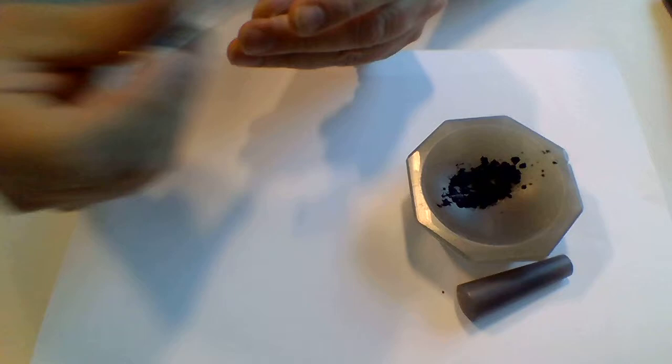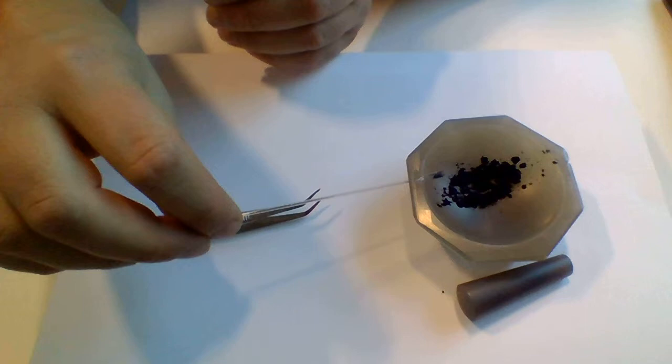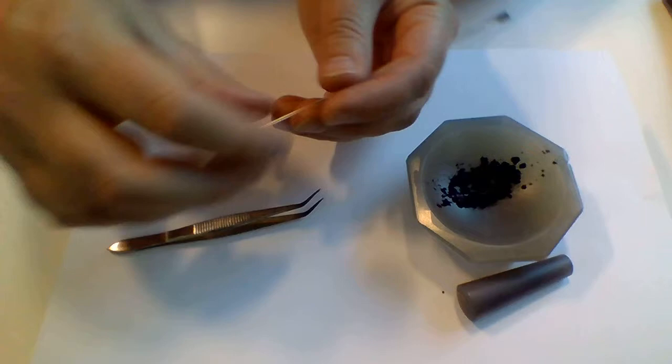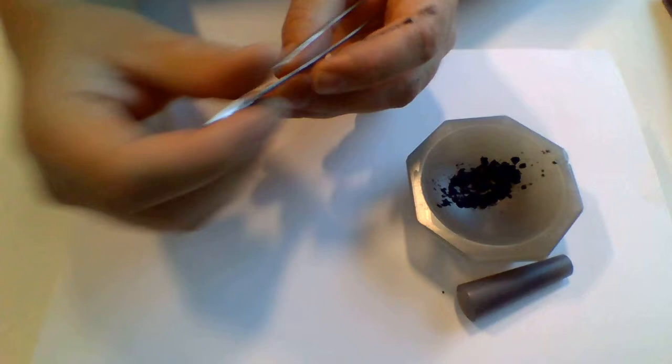So you just repeat this until the capillary is full. Take a little more sample, and in order to make this easy for myself I have actually cheated a little bit and I have taken a relatively large sized capillary.